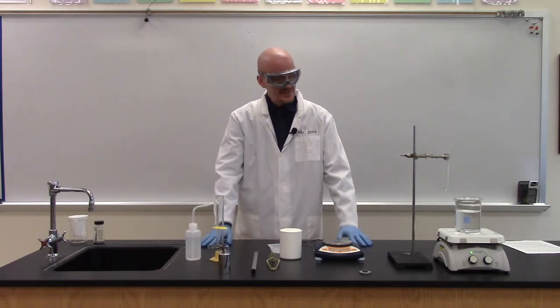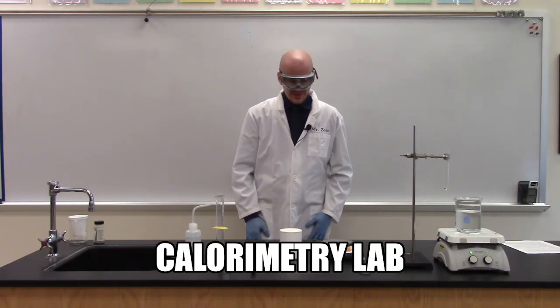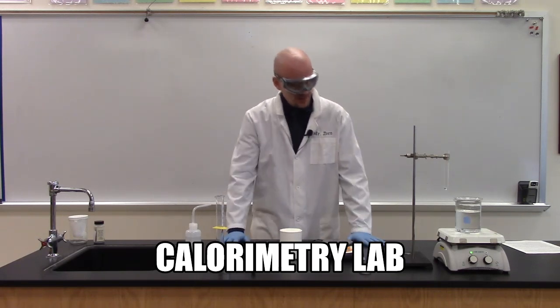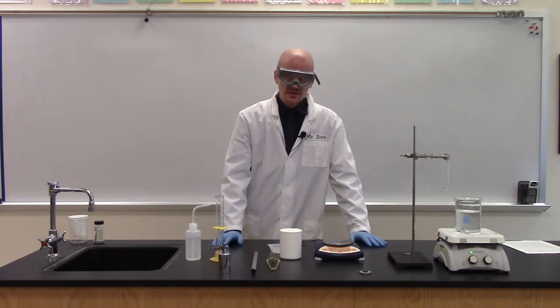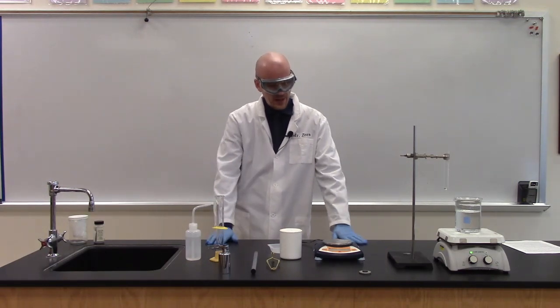Hello, I'm Mr. Zorn and this is the calorimetry lab. In this exciting chemistry lab we are going to be finding the specific heat of a metal using the known specific heat of water.